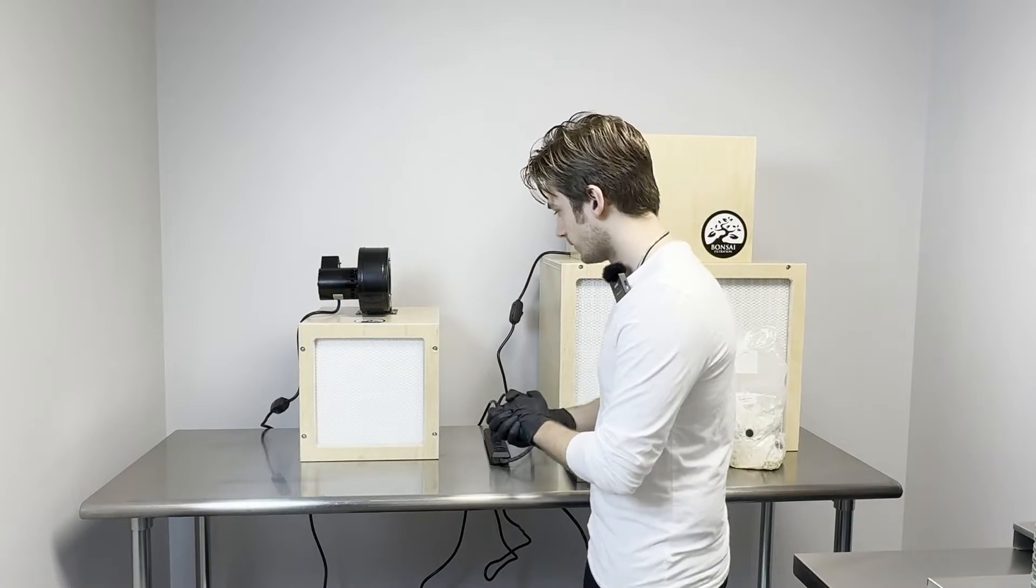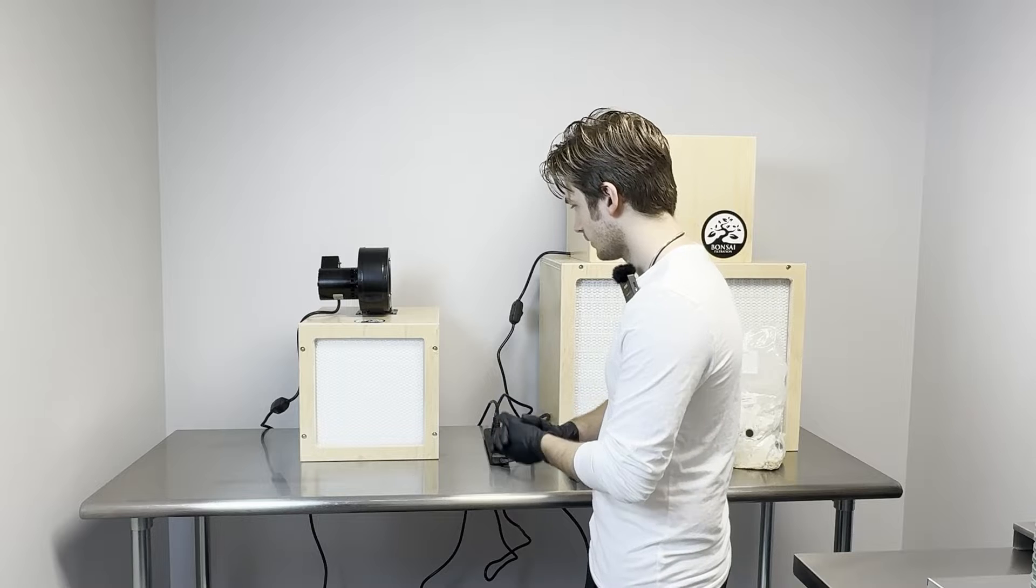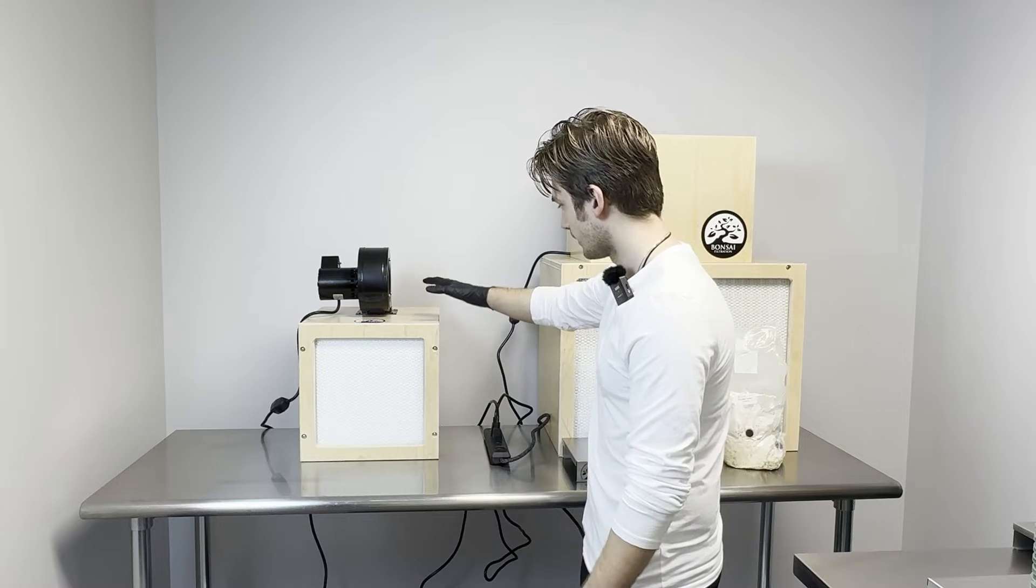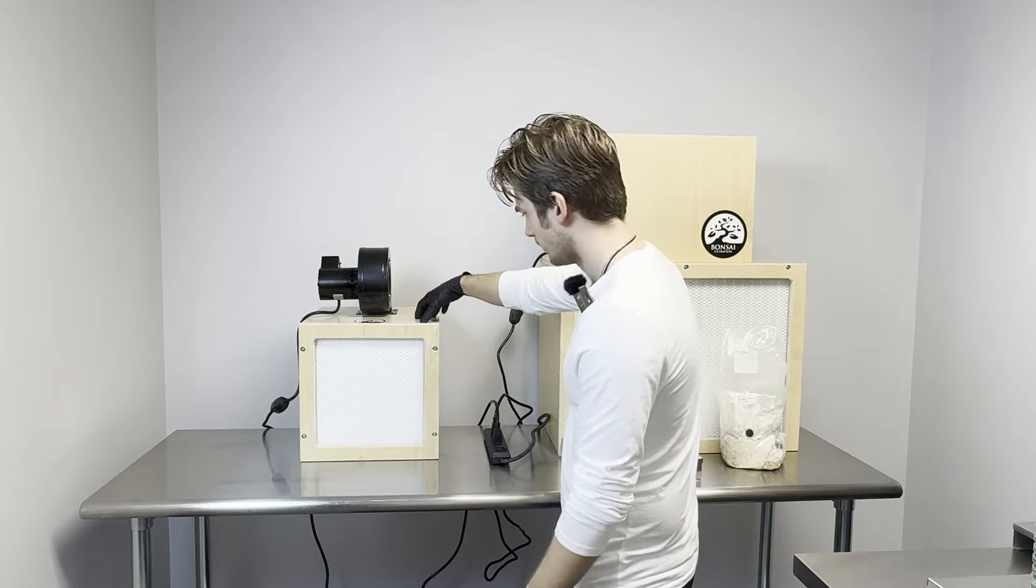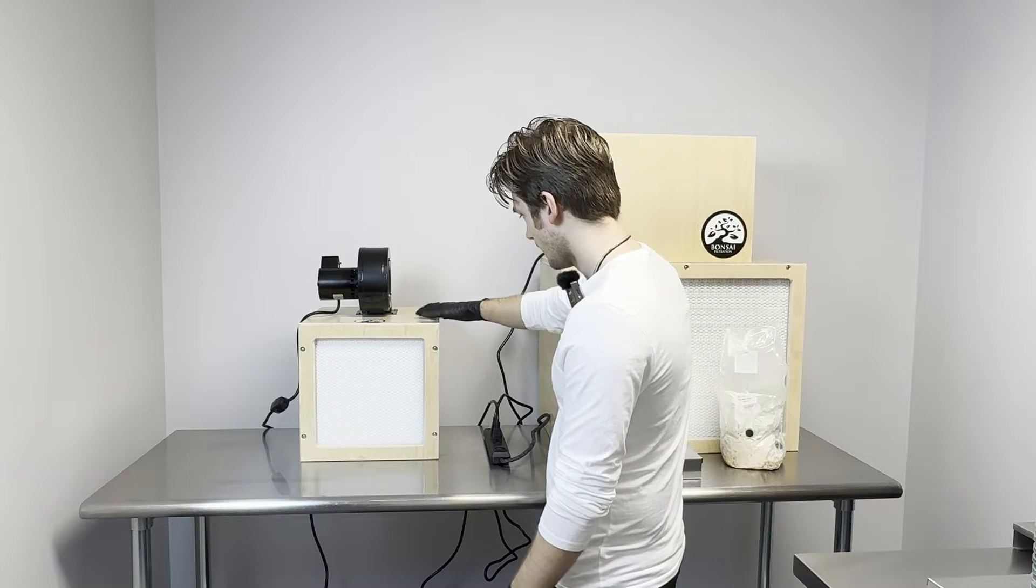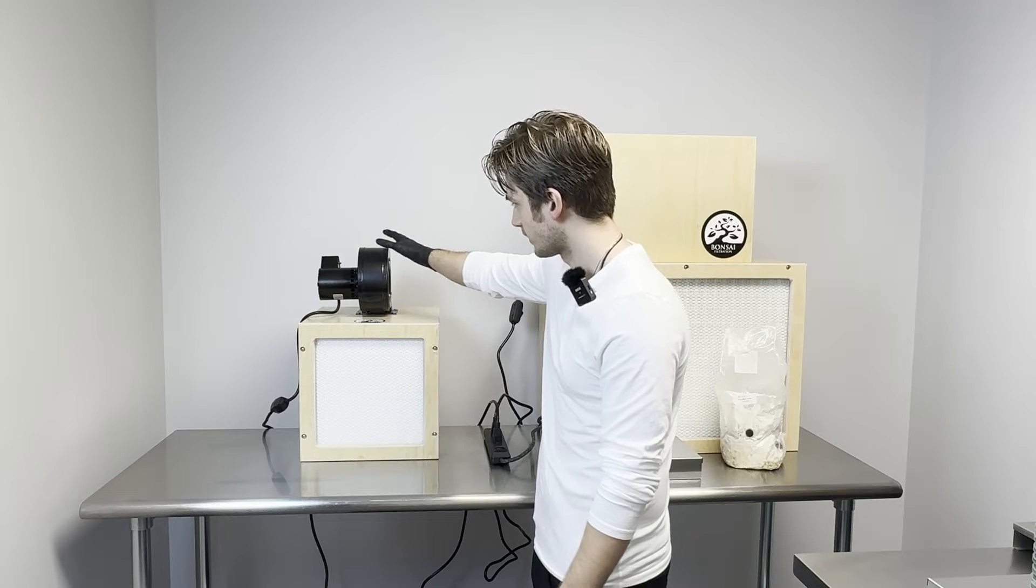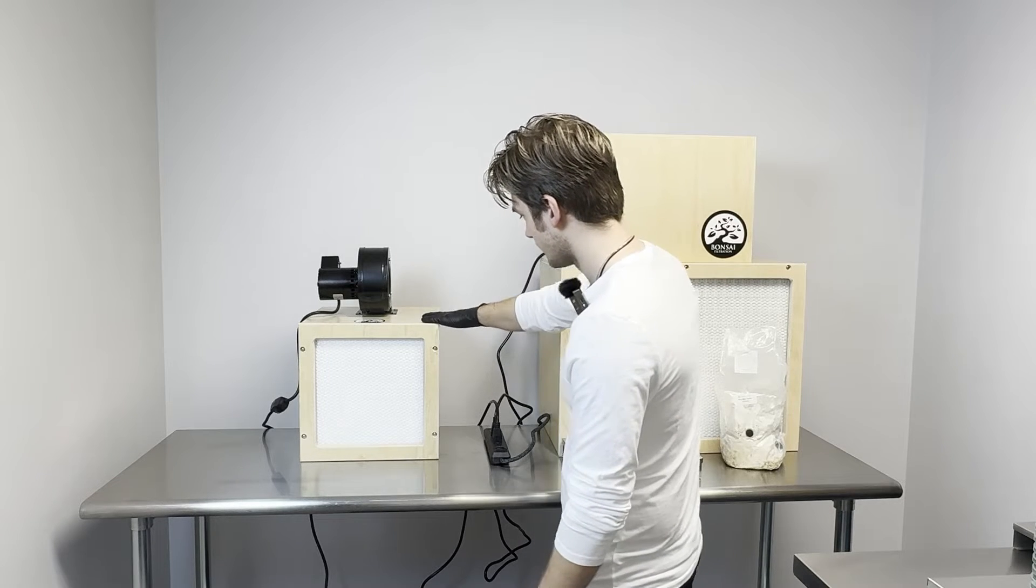This is your HEPA flow 12 by Bonsai. It is their lightest and most portable model, weighs just a little over 20 pounds. If you are going to be using this, make sure to plug it into a surge protector in order to protect your motor.